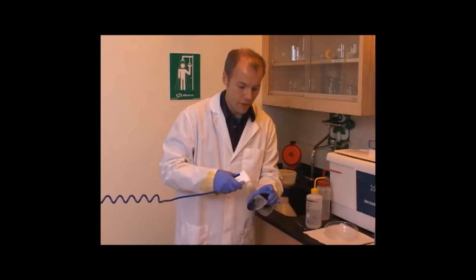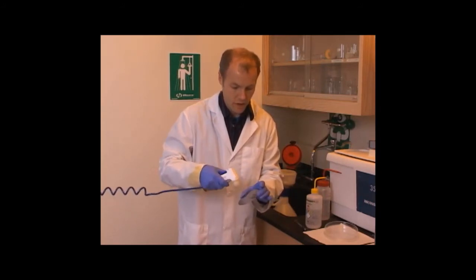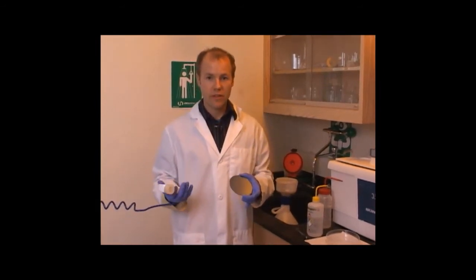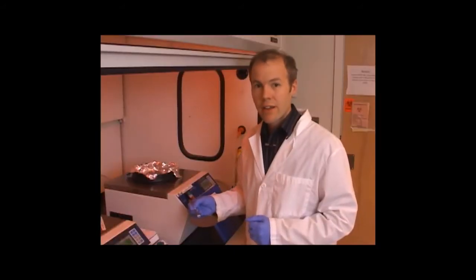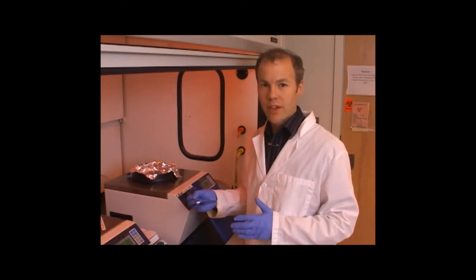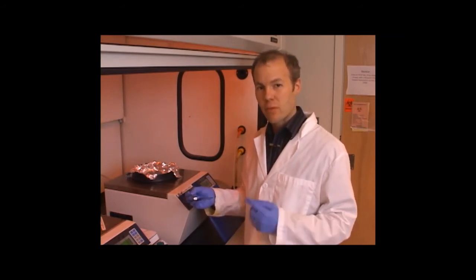Once this wafer is clean, I can spin coat it with the ebeam sensitive resist and make sure that the bonding to the surface is good. The thickness of the resist layer on the wafer can be controlled by playing with the viscosity of the resist that we're applying and also the speed that it's spinning at.